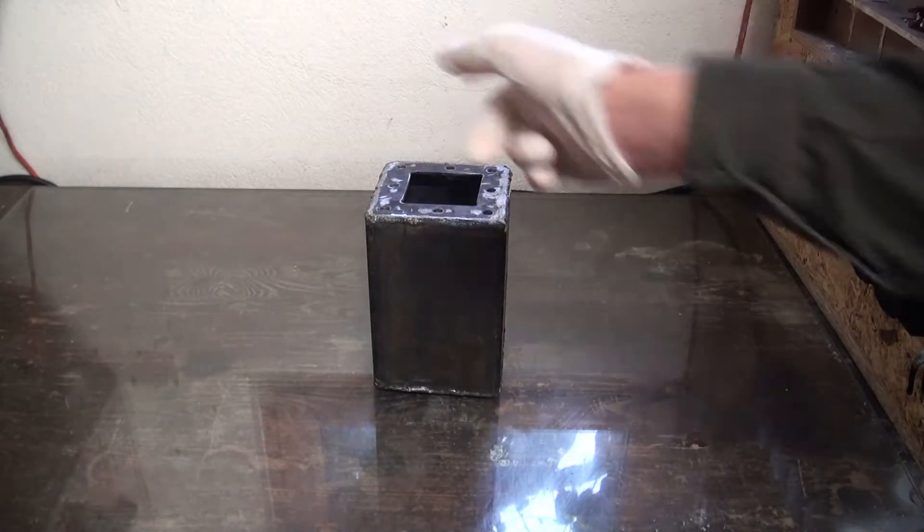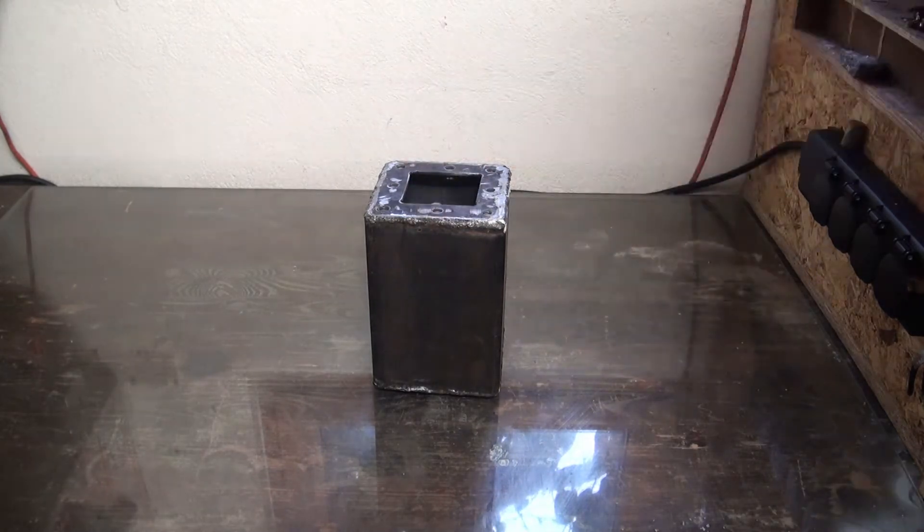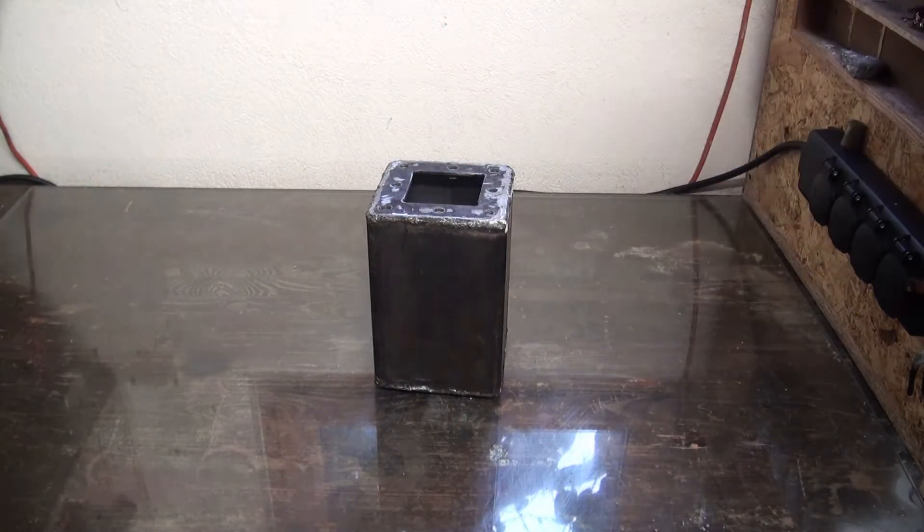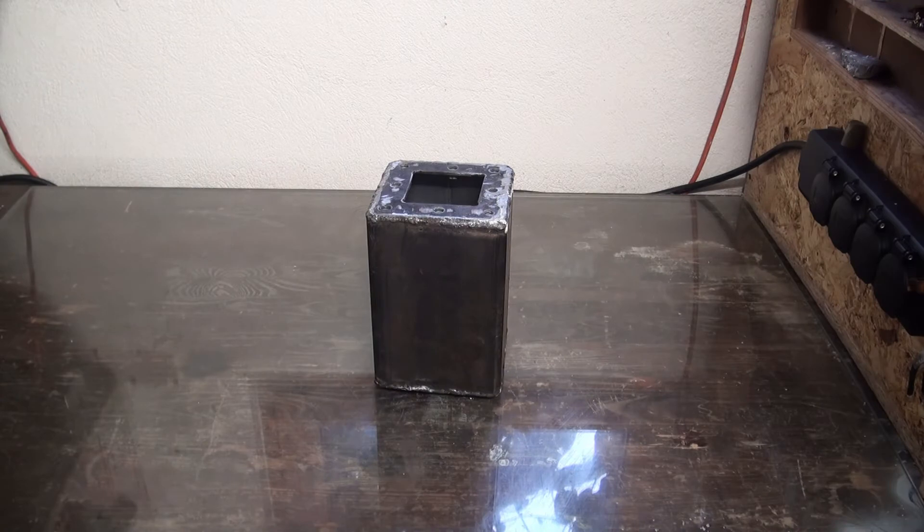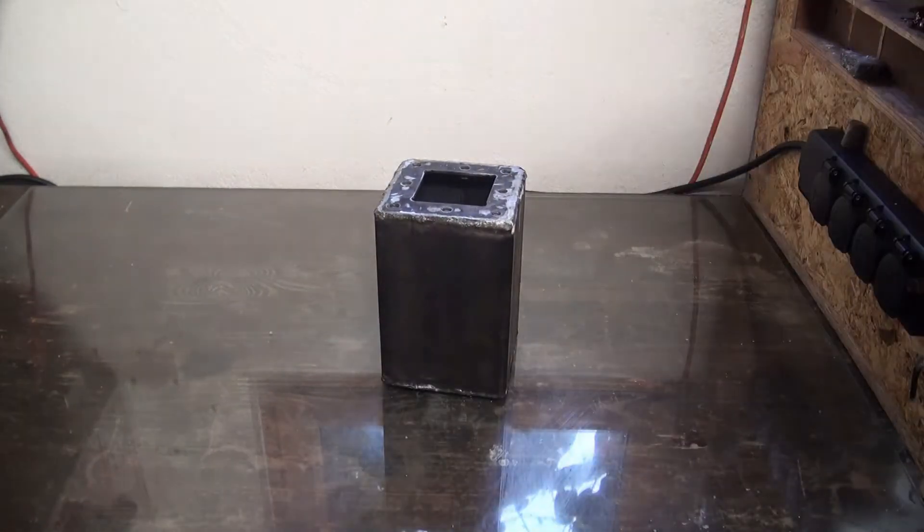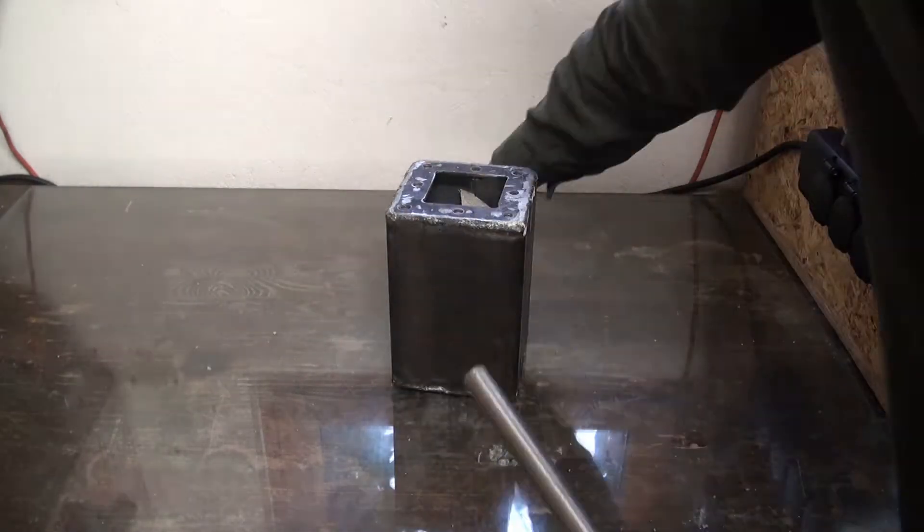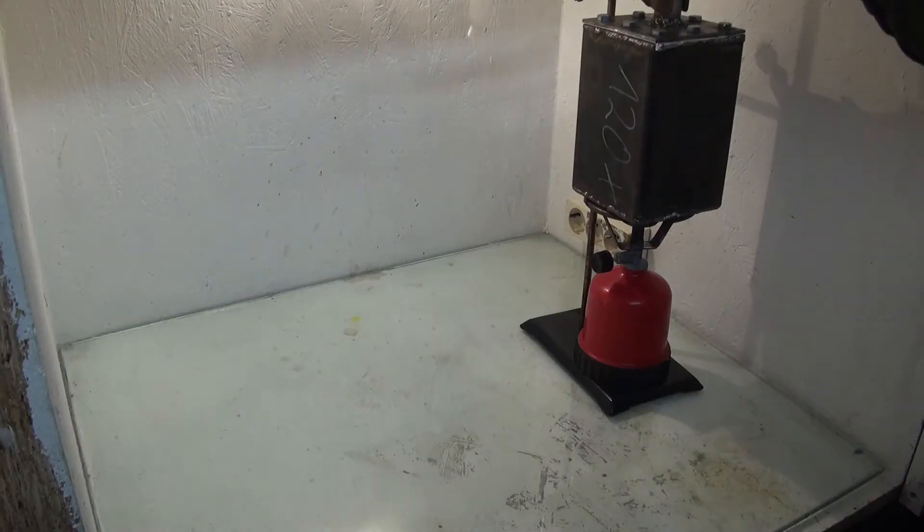After the white styrofoam was beaten, the pieces were added to a self-made pyrolysis reactor. This is simply an airtight steel container. A condenser can be attached to it. A steel can can also be used.